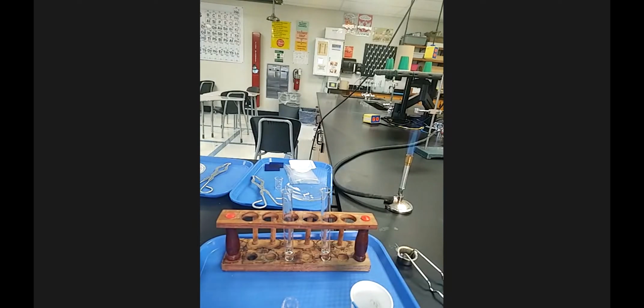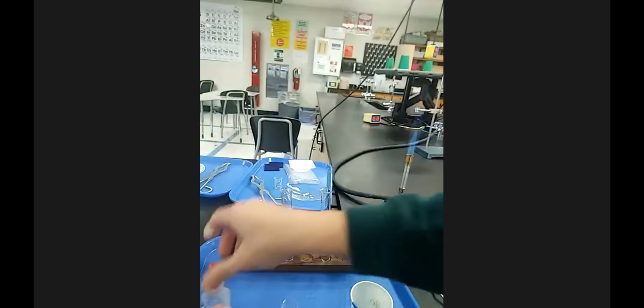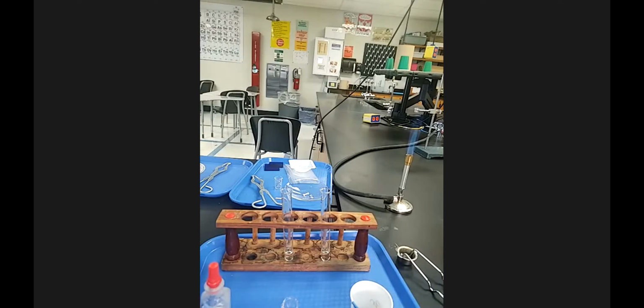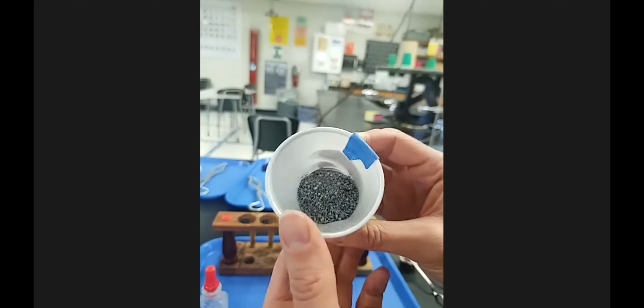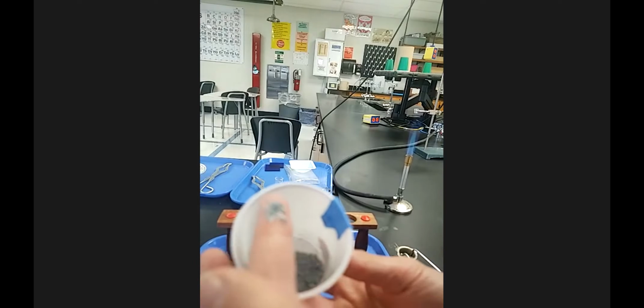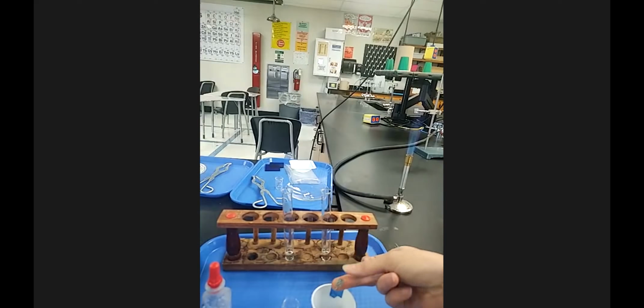All right, so there's the hydrochloric acid. Just grabbed my dropper from the sink that I'd set it down in, and I'm gonna close that back up. This one I'm gonna set back in the sink because I don't want to leave that on my tray or anything. All right, so we got the 2 dropperfuls. I'm gonna do the first one with adding some zinc. This is some zinc granules, and metals are stuff you can pick up with your hands and feel. It's very grainy. Let me grab some and then put the magnifying glass on there.